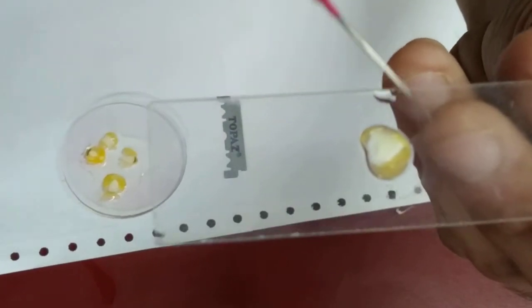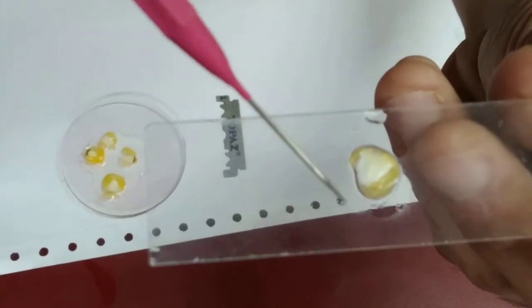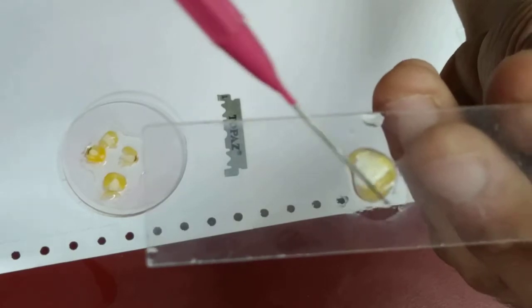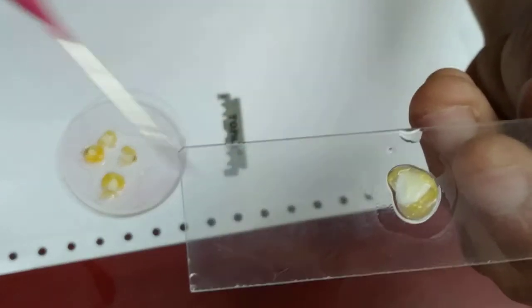So we are going to observe this under a microscope. This is what you are supposed to see after cutting the longitudinal section of the maize seed.